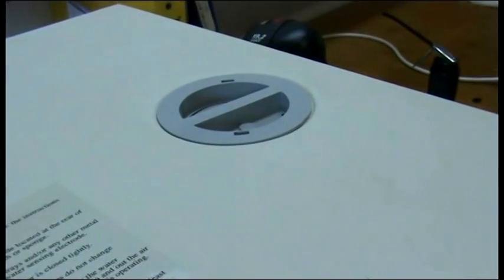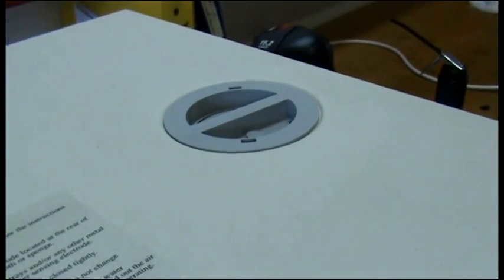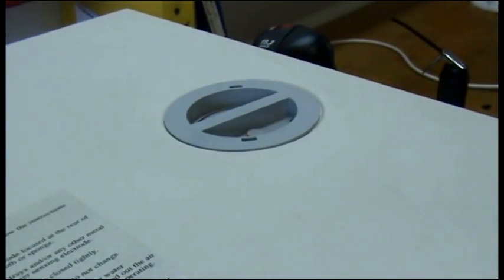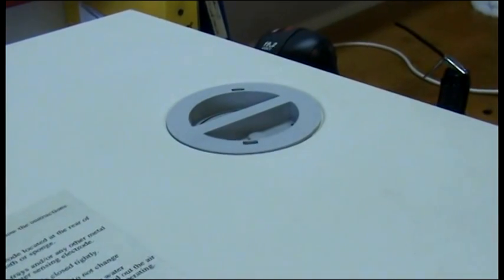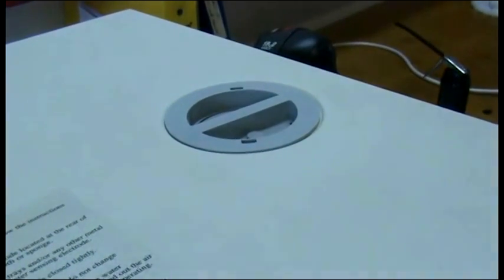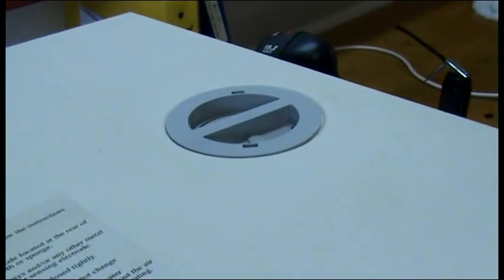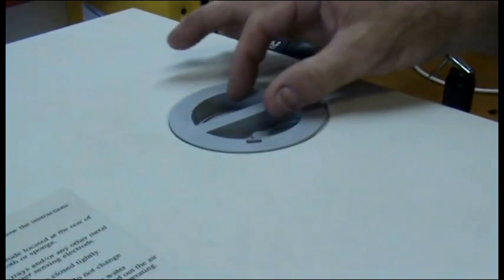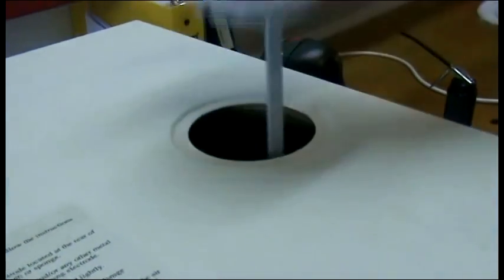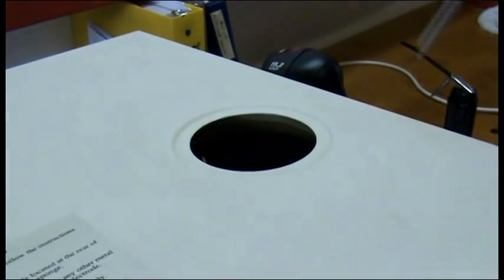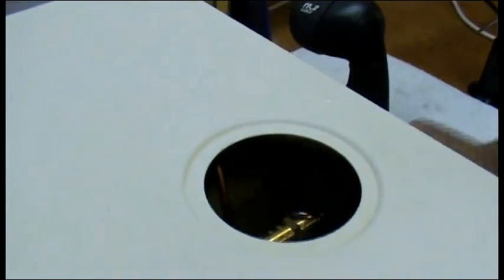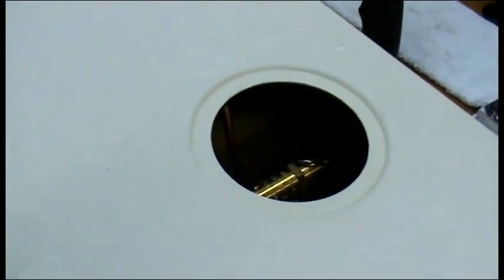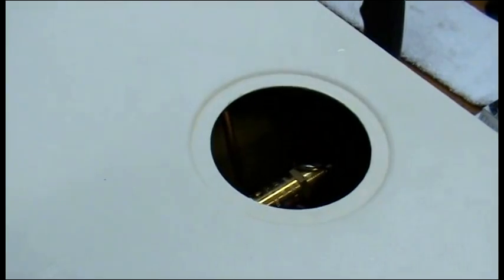Cleaning the air jet valves is one of the most important maintenance functions of the autoclave. It is a small device, and yet it controls how much steam is in the chamber. Without it, you will fail spore tests. Make sure you do this procedure weekly.